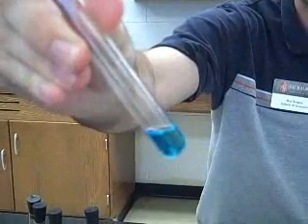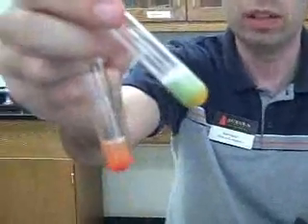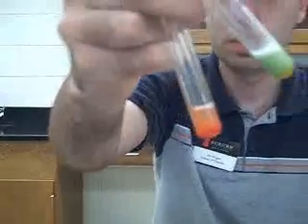For simple sugars, we use the Benedict's test — the only test in this lab we had to heat up in the water bath. Benedict's is blue, so a negative test is blue. If you get any color other than blue, it's a positive test. Orange, green, yellow, and reddish are all positive. Any color other than blue is positive for simple sugars — monosaccharides and disaccharides.